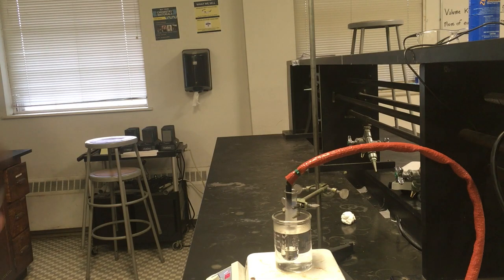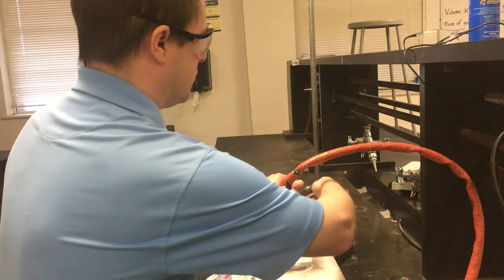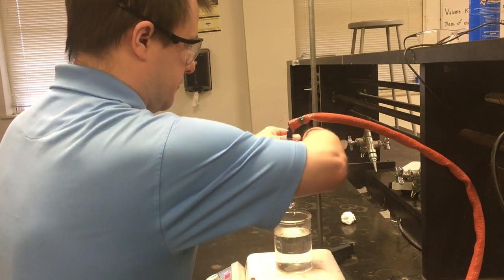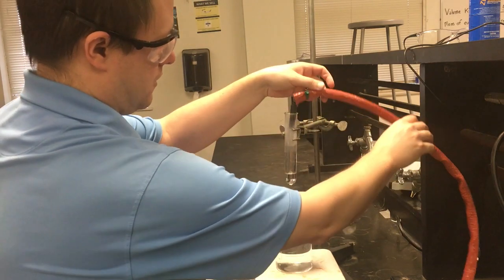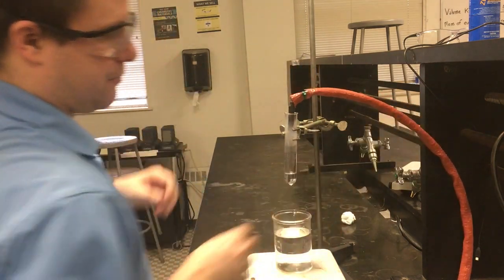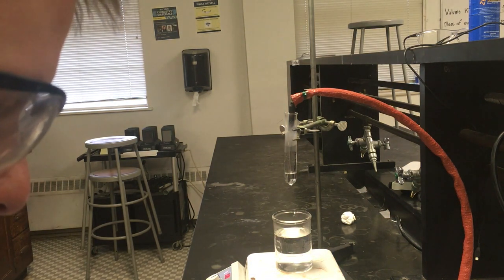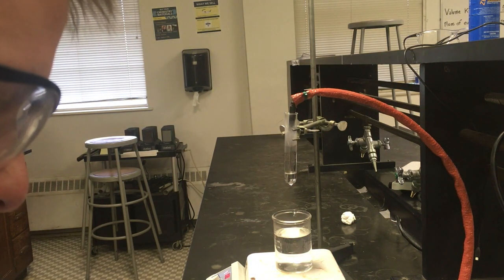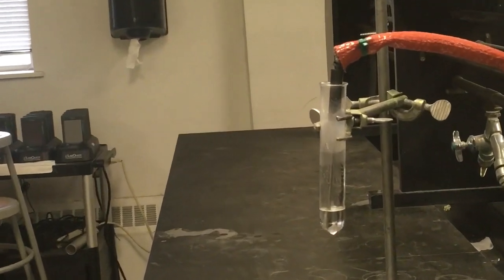So it looks like actually everything is already melted. So I'm going to go ahead and lift our test tube up out of the hot water. And again, I have everything set up here ready to record. I'm going to get my LabQuest ready. Tell it to record but store my previous data. For those of you that may have to use them again in the future, if you tell it to store and record, it'll keep all of your data for all of your trials in one file that you can look at later.